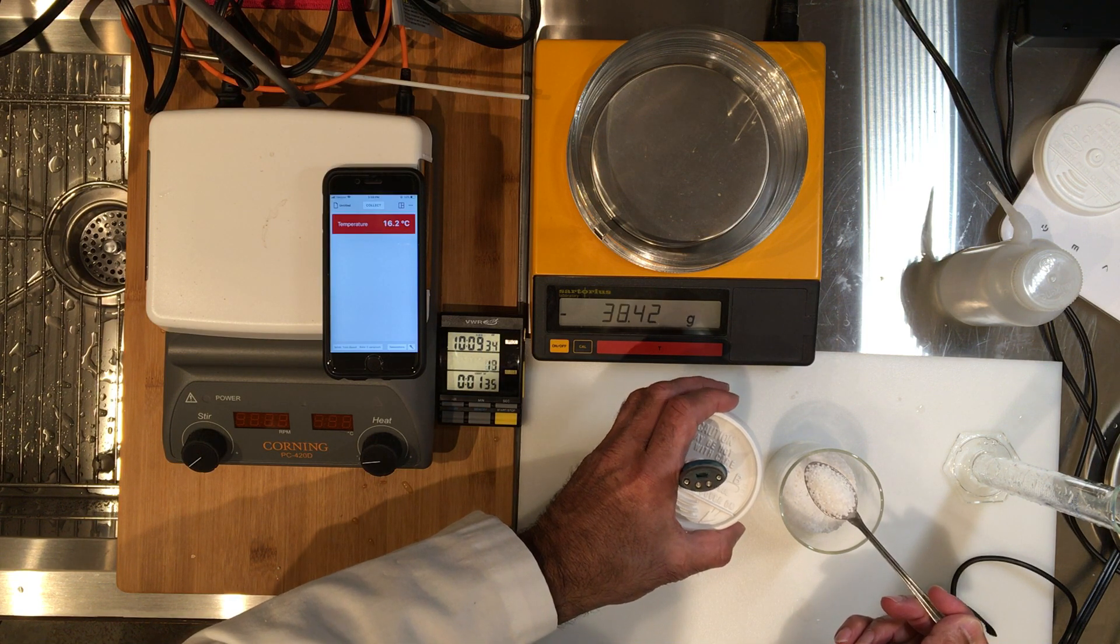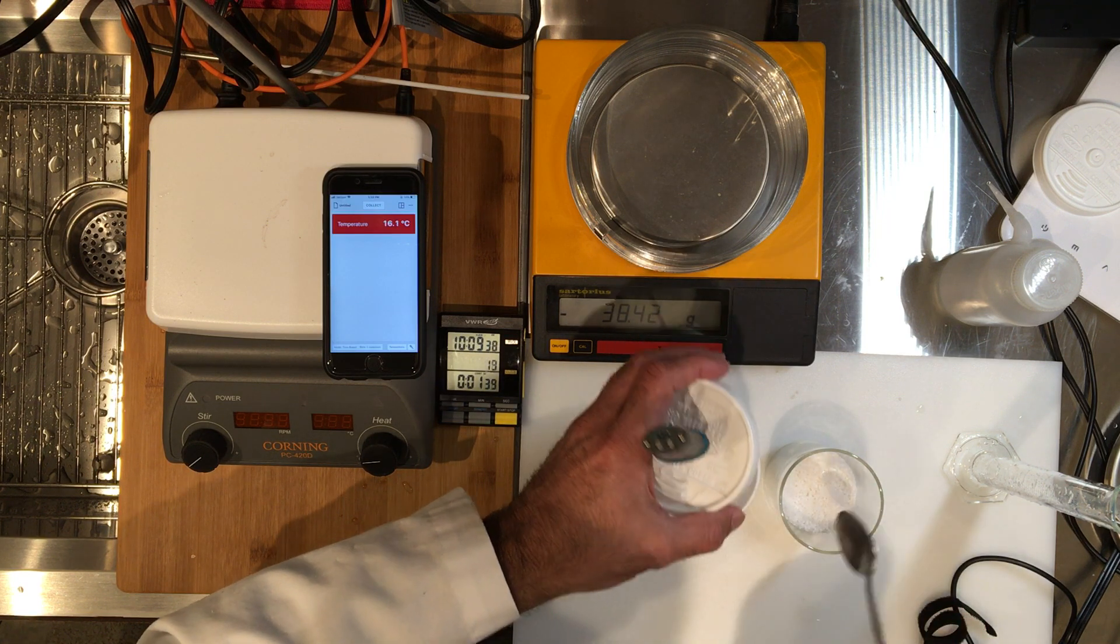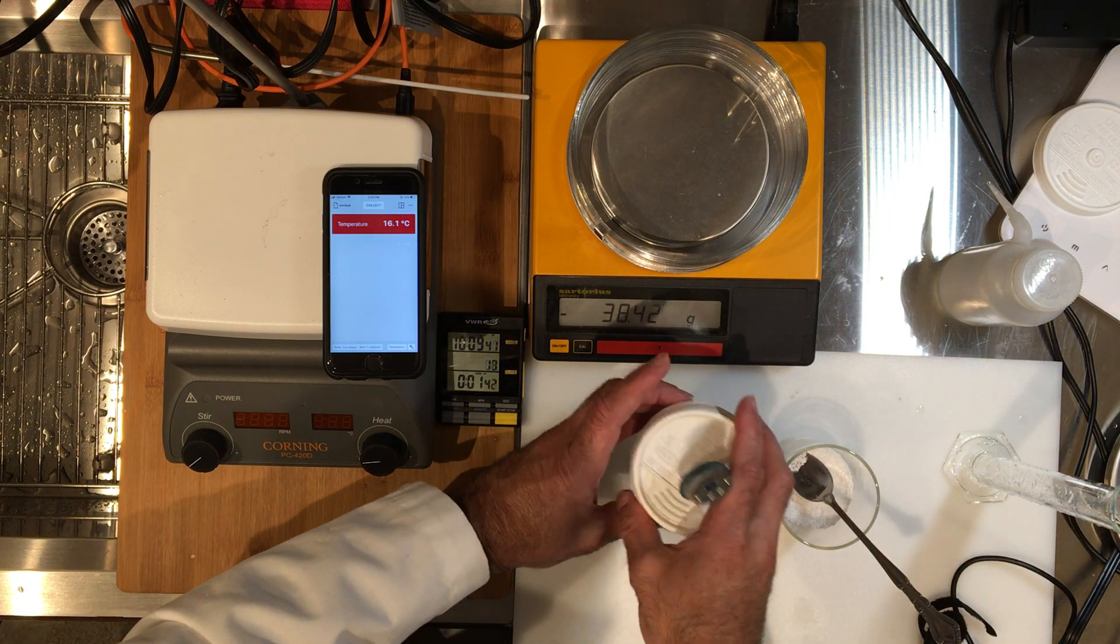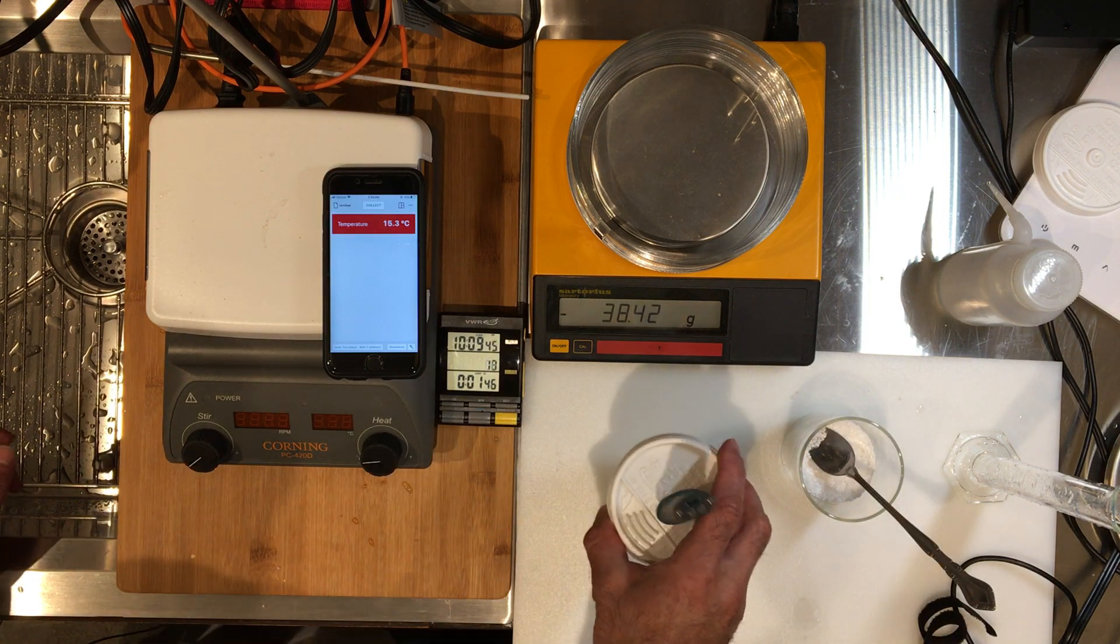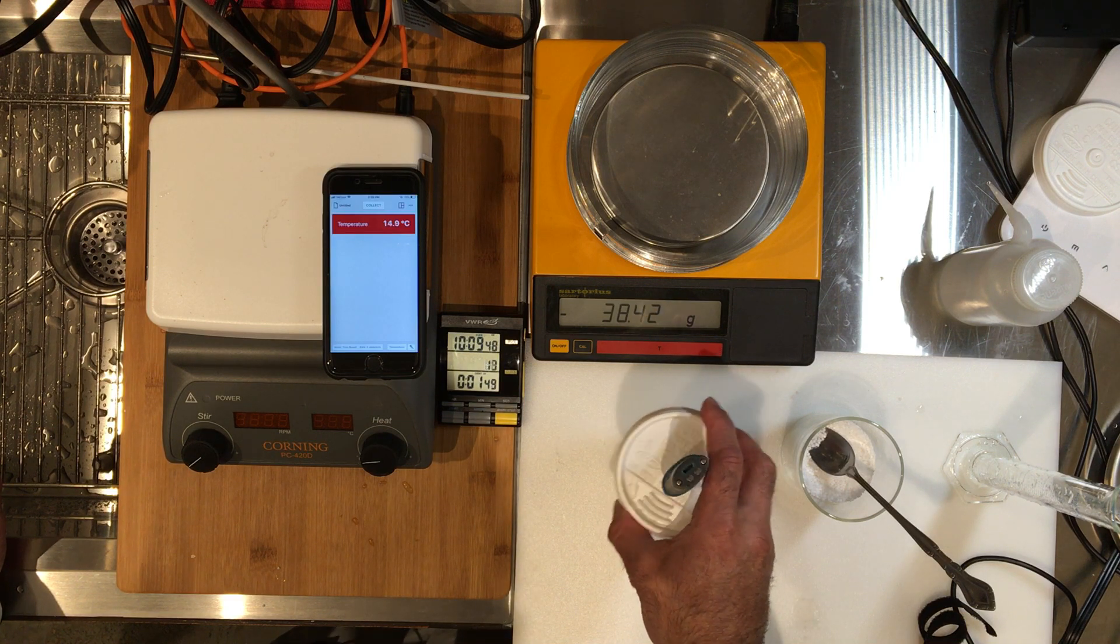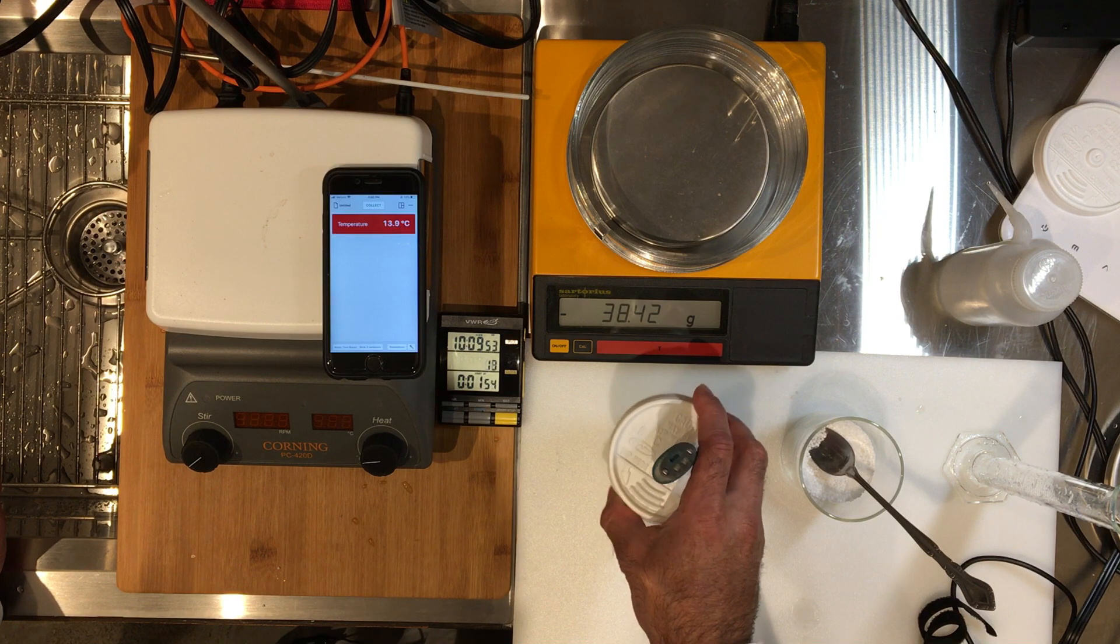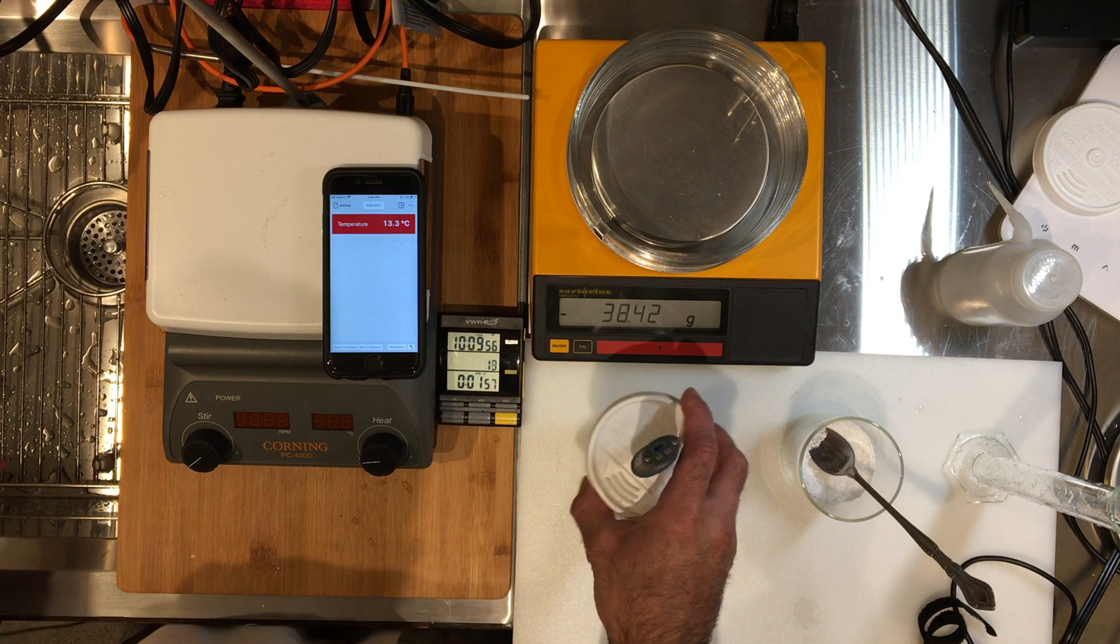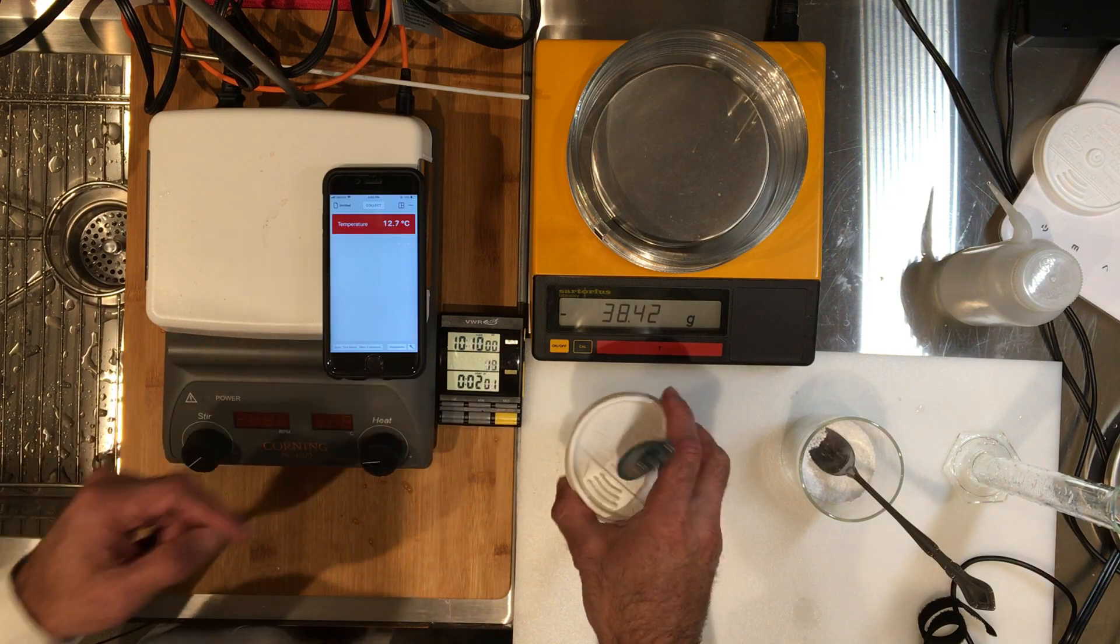Okay, now don't make any measurements. Let's wait till I pour this in. So I'm going to pour this in and I'm going to quickly mix. At this point keep measuring. Your next one coming up would be two minutes. Now I can hear that there's solids inside of this, so you cannot record the final temperature yet. But do record this. Two minutes recorded. 12.7.